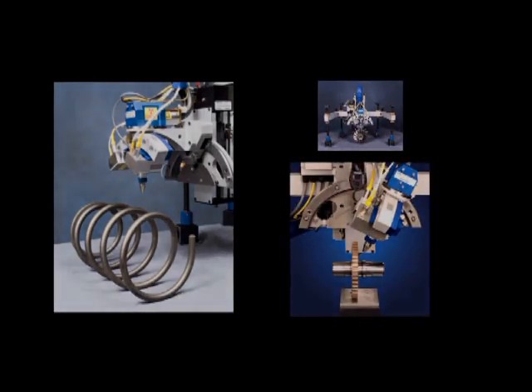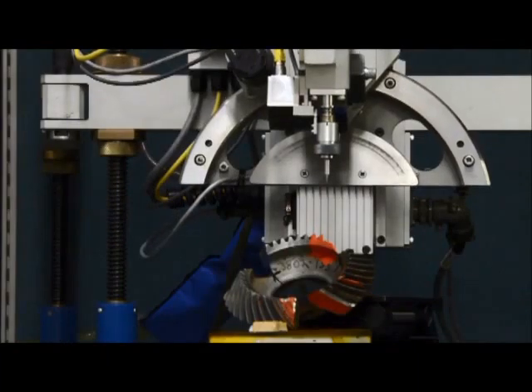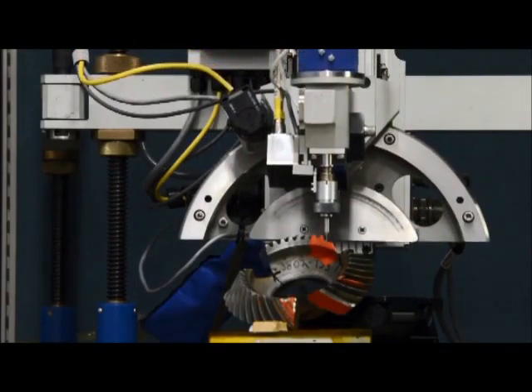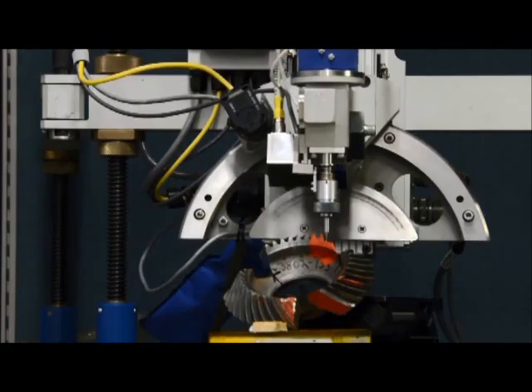We also measure retained austenite. Retained austenite is a phase in steel. It's very critical to applications where there are tight dimensional tolerances, such as bearings. The measurement of retained austenite by X-ray diffraction is the preferred technique because we can measure retained austenite in amounts less than 10 or 15%. In fact, for aerospace applications, there are often specifications for less than 8% and sometimes even less than 3%.